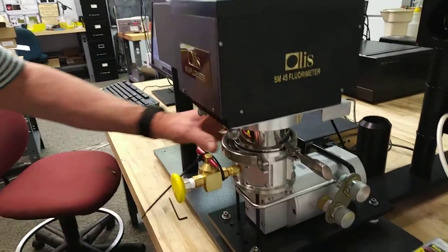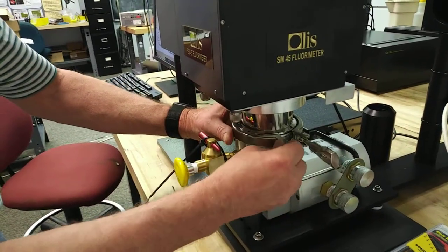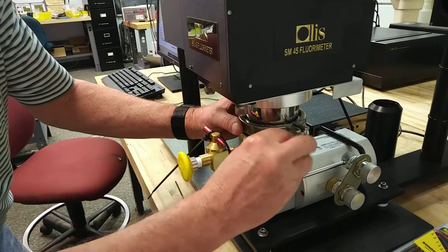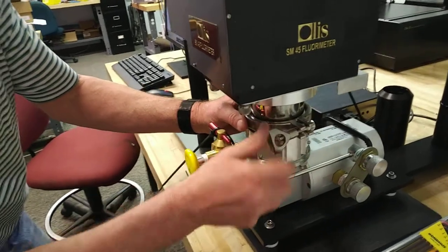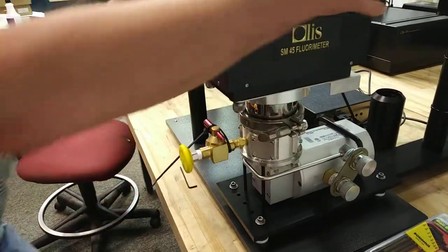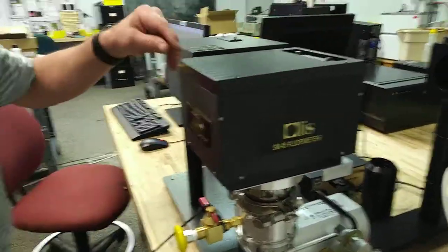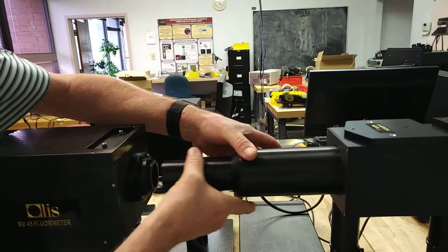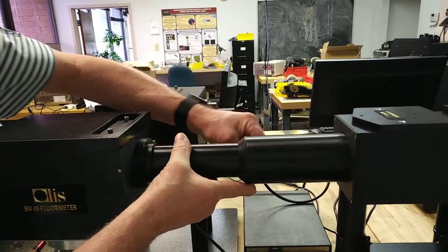To put it back, you put the clamp down and set it back on loosely. Align the chamber so that it lines up with the tubes, and then slide your tube back on here. Then the clamp tube here — you just tighten a screw; there's a thumb screw on the side.